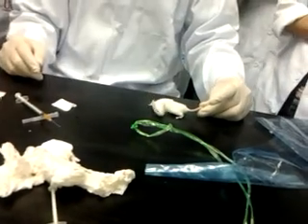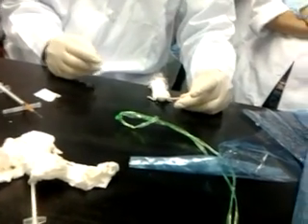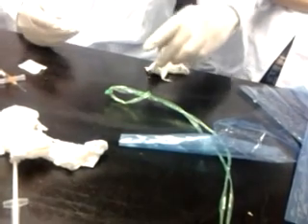Not enough, because we have excess drug that this does not need. Don't worry, we'll prepare it again. Leave it inside first. Can we try the cardiac puncture again? It's a very big challenge for us.